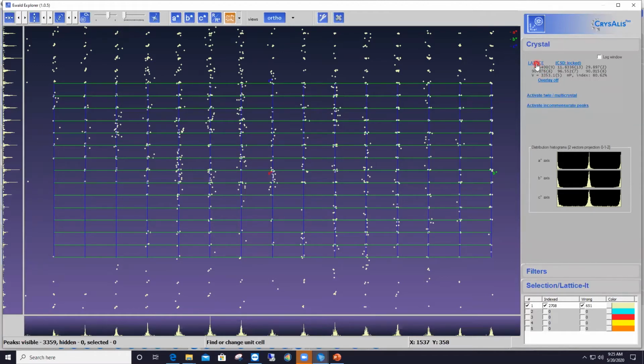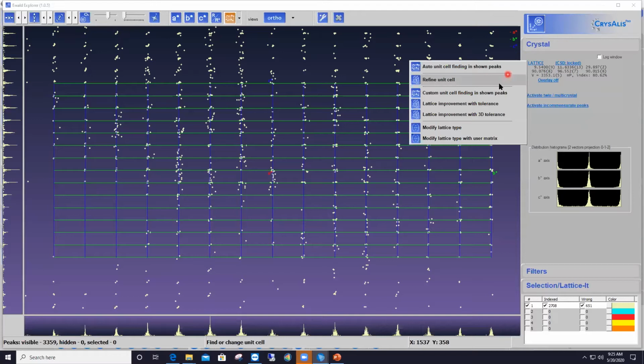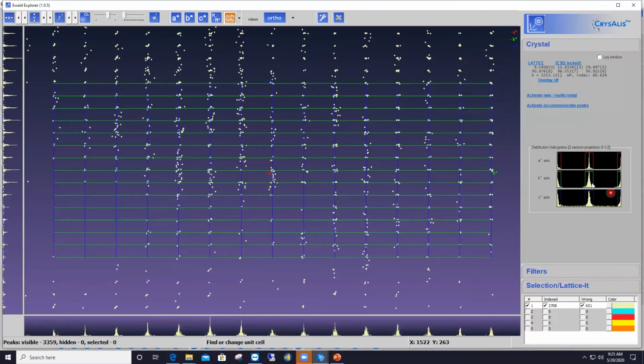If I left click on the lattice link here and say refine unit cell, just to bring about the display of the lattice points here on the intensity histogram along A star, B star, and C star, and here I'm talking about the red, green, and blue boxes. If those boxes don't appear, left click on the blue lattice link here and say refine unit cell, and they will appear.